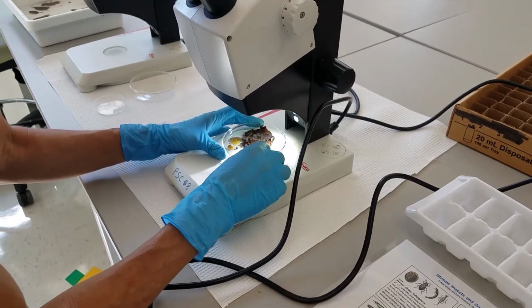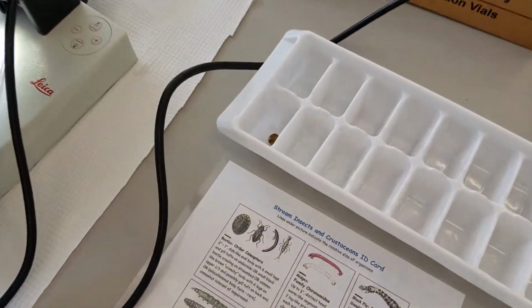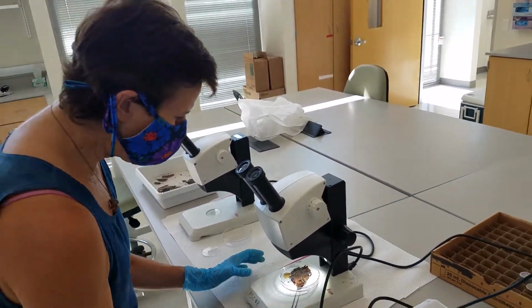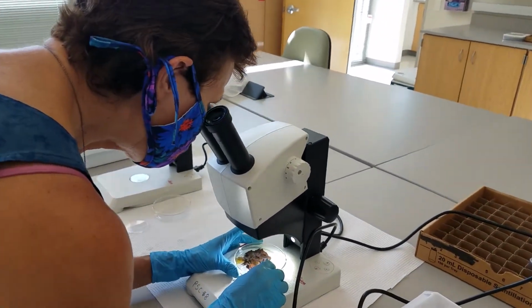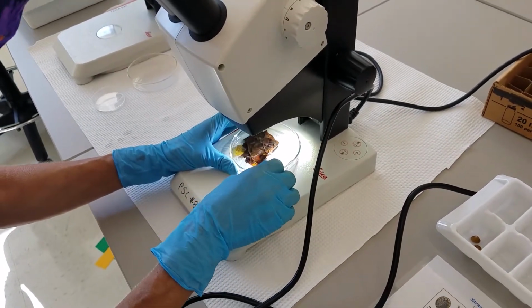So you basically move the tray around. I've got a couple clams here, so I'm going to put them into here, and I would cover this with glycerol, and then I'm just moving the leaf around and looking all over the leaf to see if there's anything that's stuck on it.